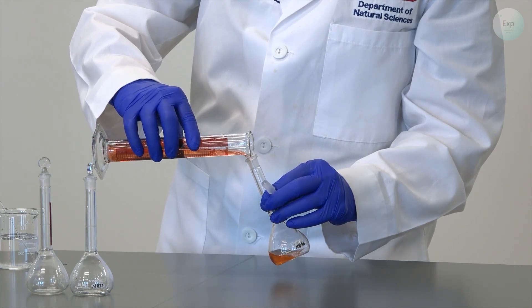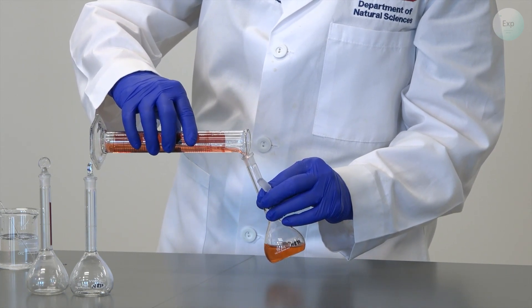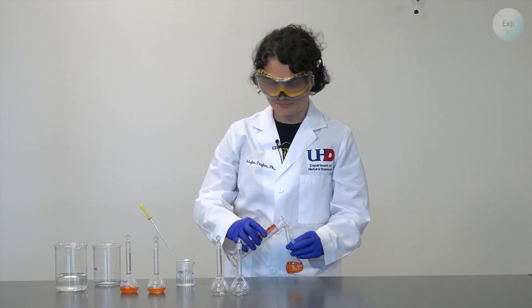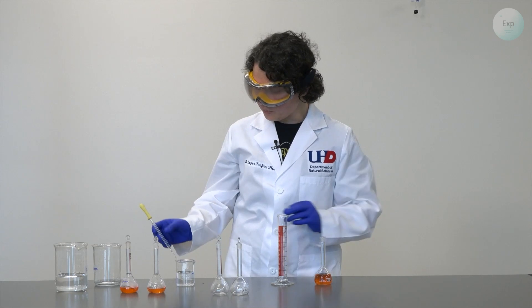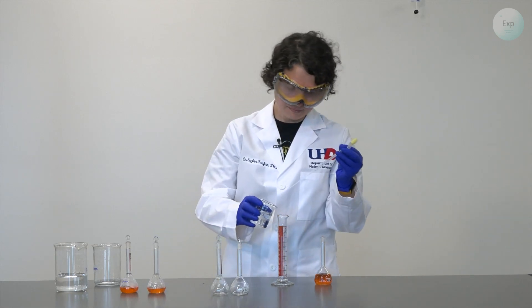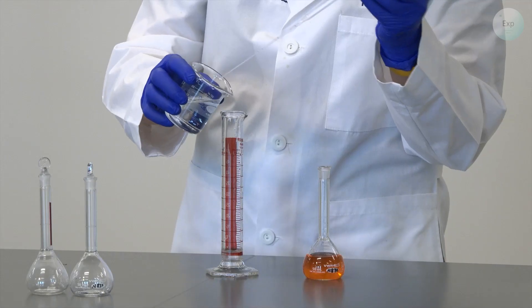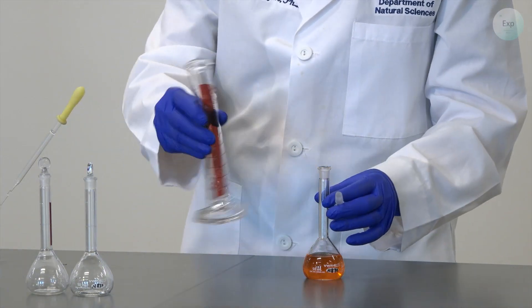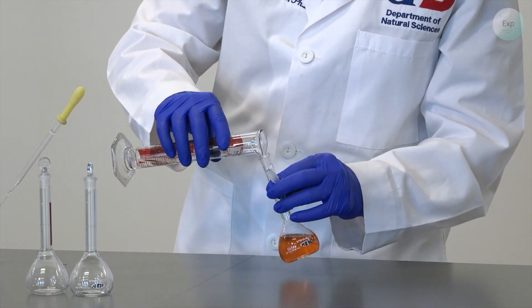This is the part where we have to be careful. If we spill the solution, we have to begin again. When we add the water, it's okay if we spill it. It's not as big of a problem because we can always adjust the amount of water at a later time as long as we don't exceed the mark.